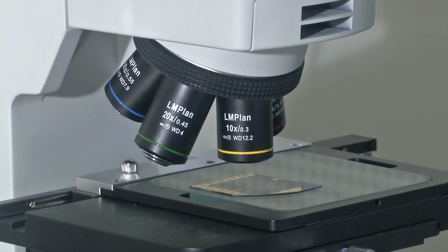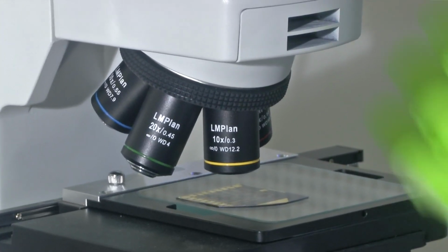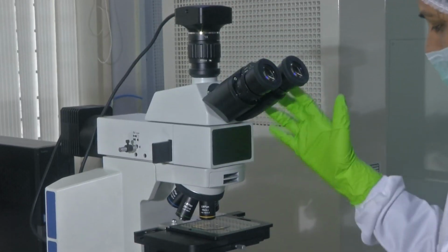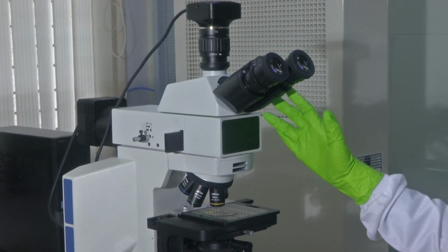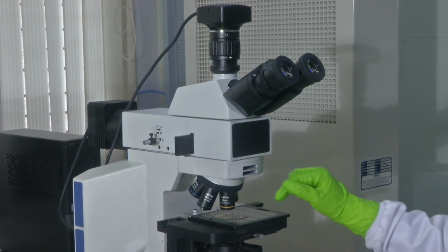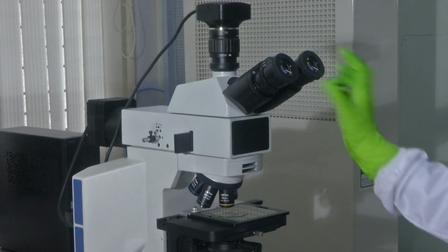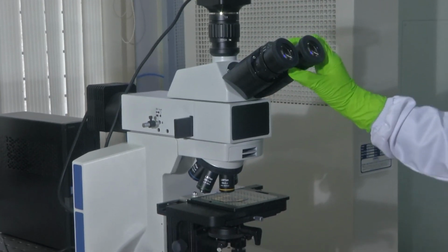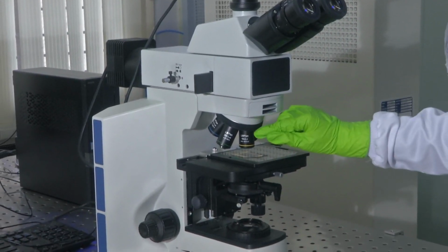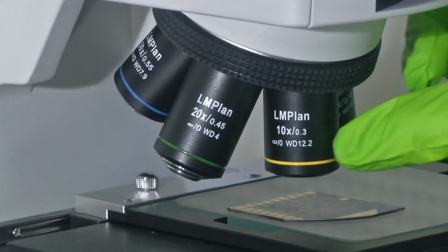So, here is the eyepiece. Like I mentioned, the power of the eyepiece here is 10x. The entire setup could give you a magnification which is a combination of the power the eyepiece can provide and your objective lens can provide. Now, the eyepiece here, just like the previous one, is written 10x. So, this can give you 10x magnification, which is fixed here as well, and you could change the magnification here. So, let us see. Now, this is focusing on a 10x objective. So, it is 10 into 10, 100x magnification that can be provided with this.